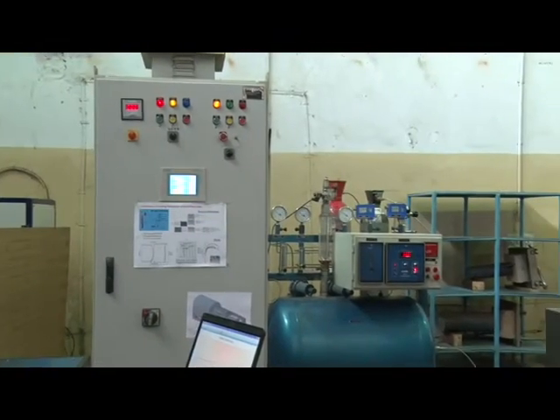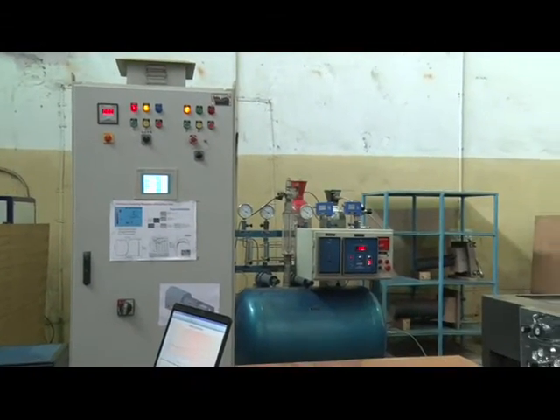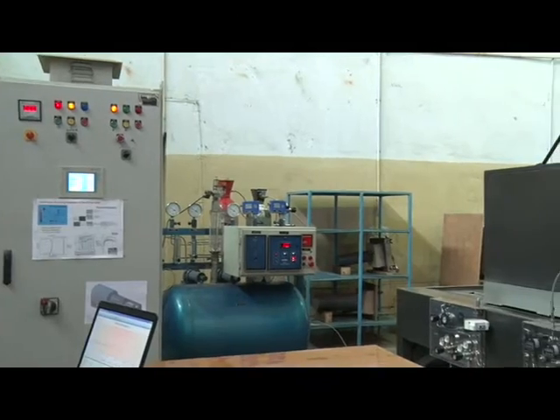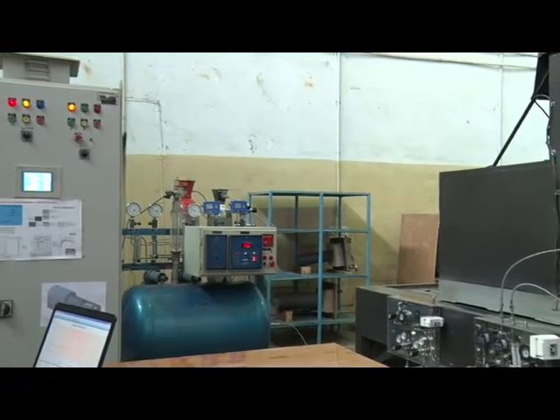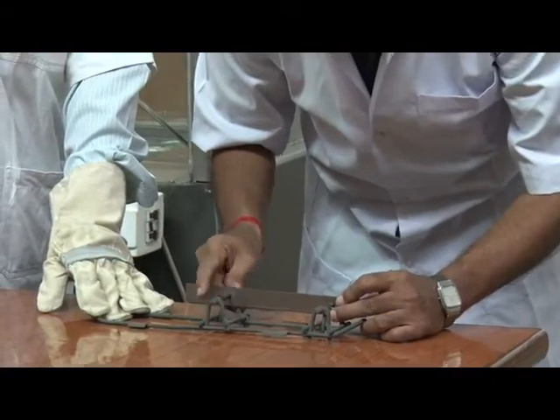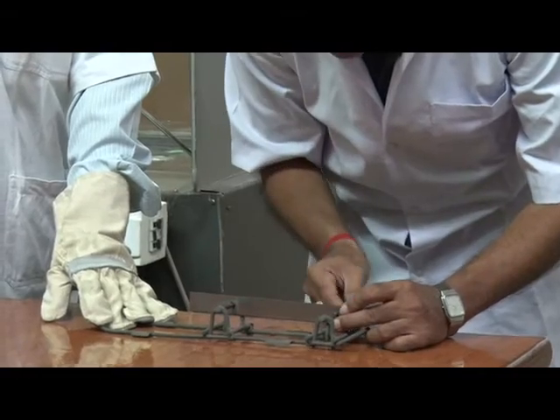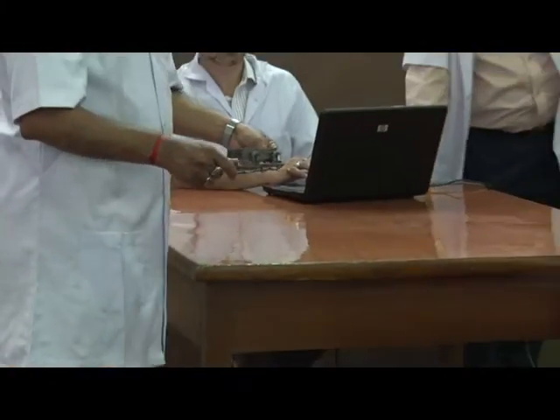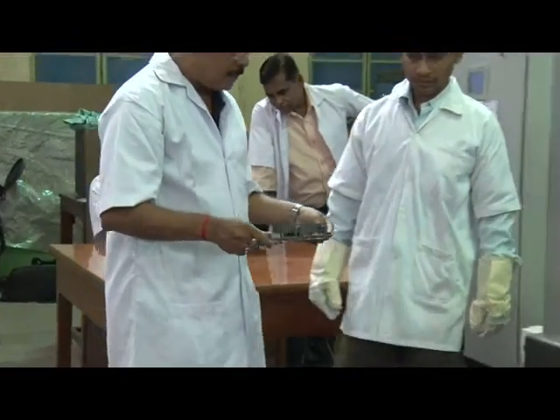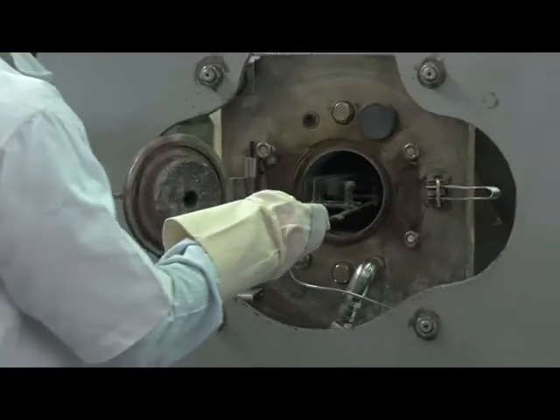You are watching various components of the simulator. Specimen mounting and its loading into the annealing chamber is being demonstrated here. The mounting frame can accommodate multiple specimens, which is an advantage over commercially available simulators.